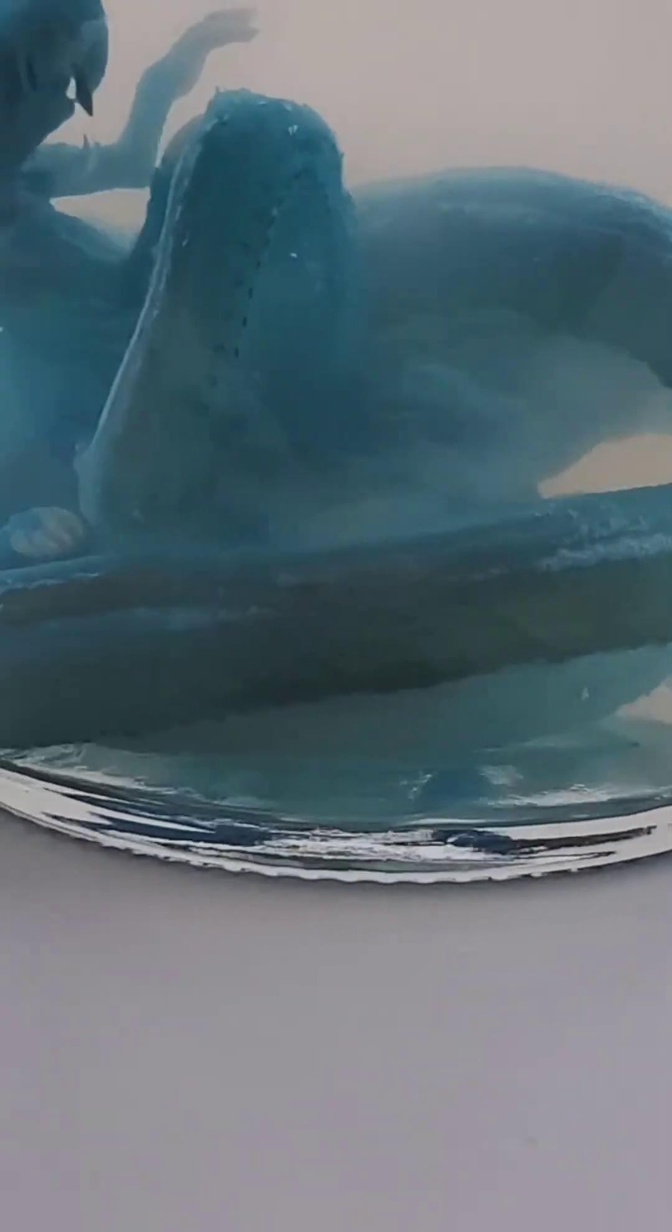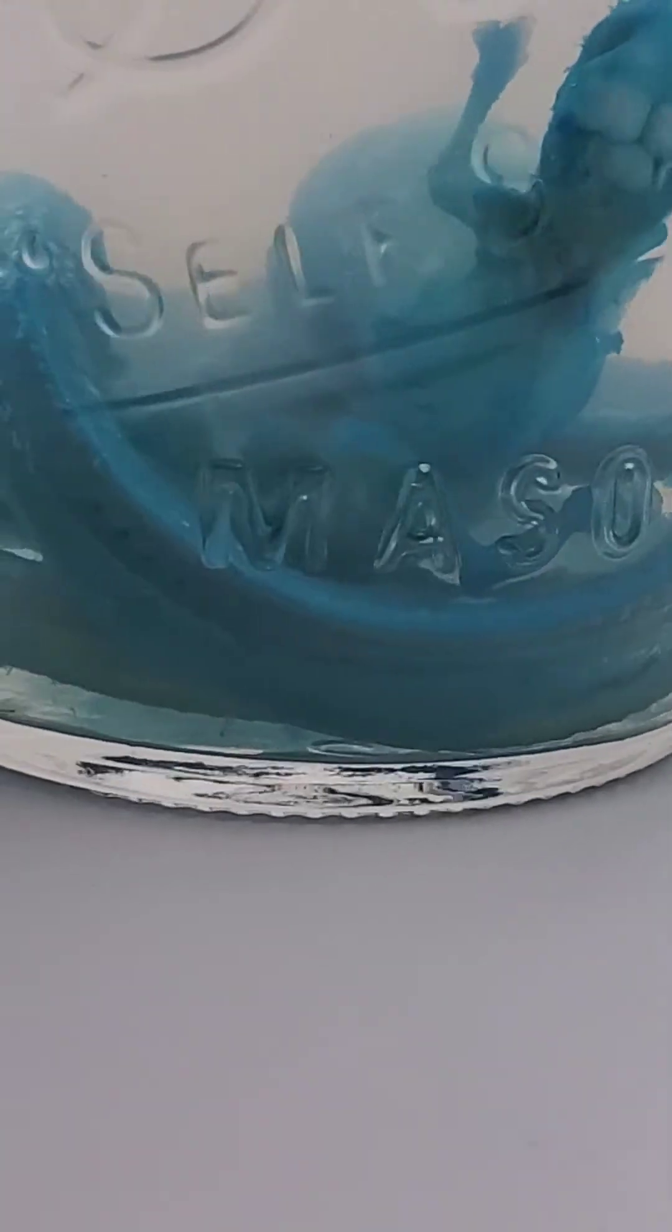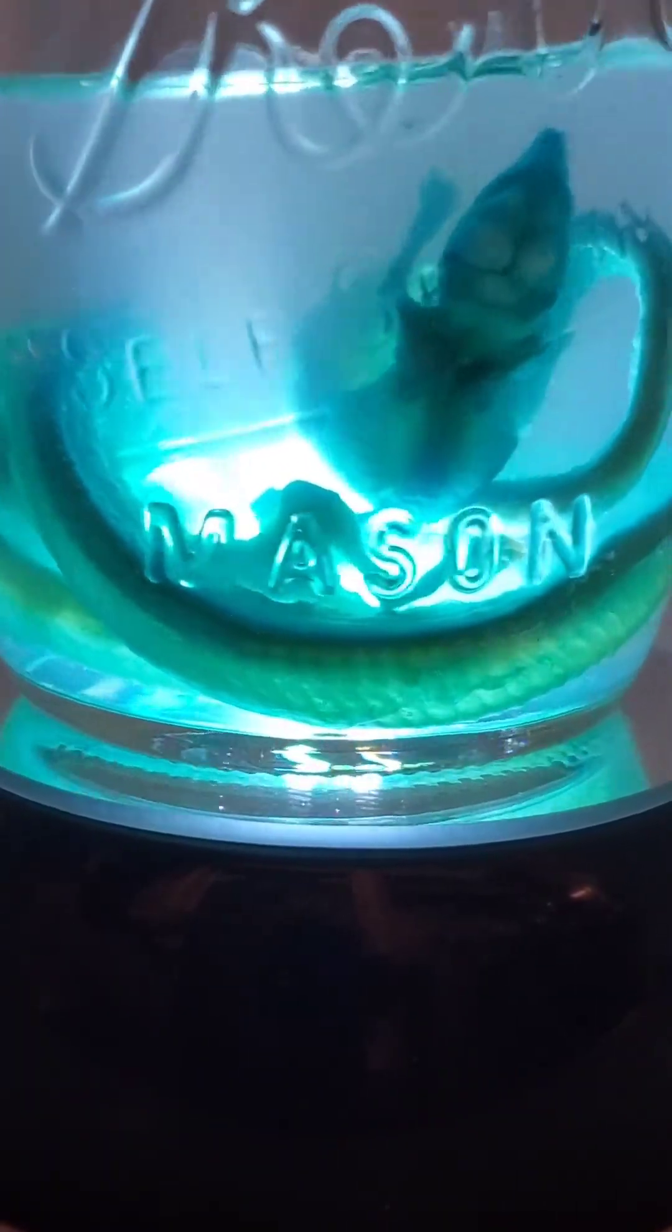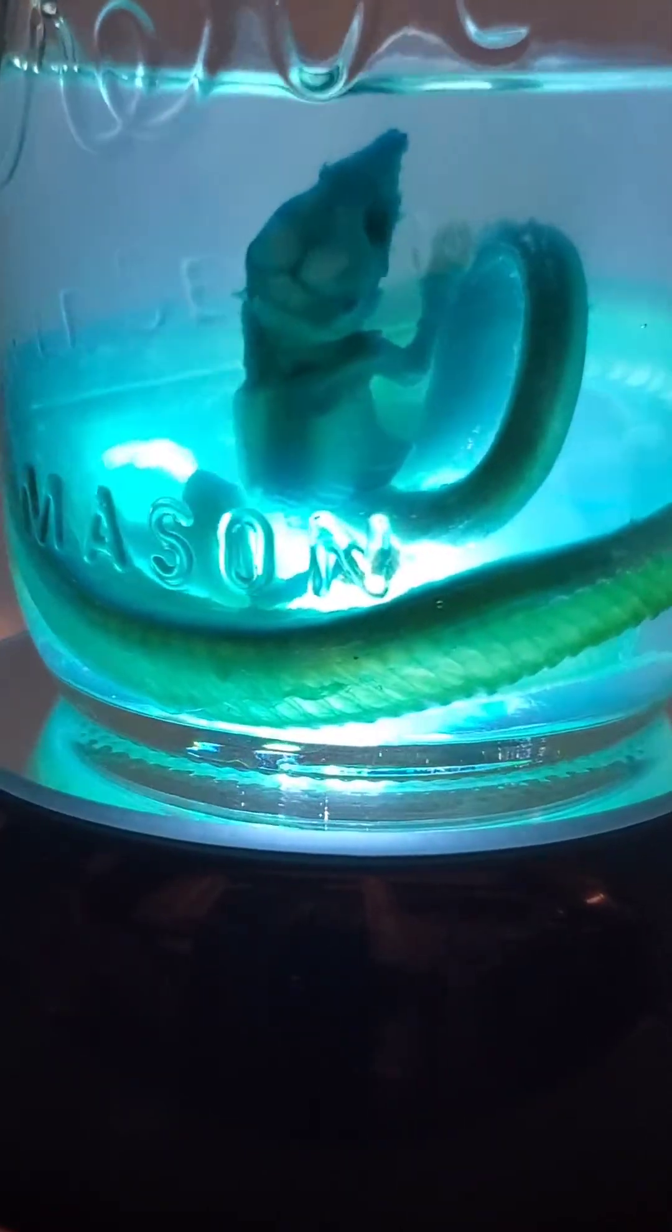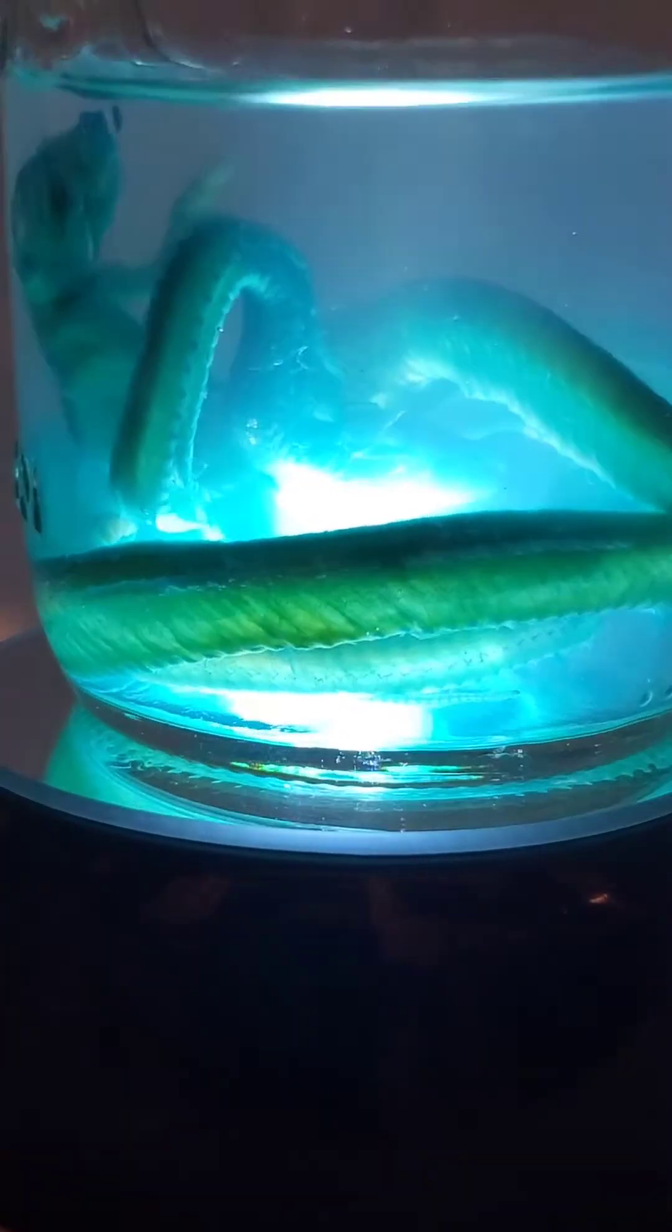Okay, so I just want to take you through how the trypsin bath is going to affect the specimens. Here's what they look like right after we put them in. Here they are after 12 hours. As you can see, they're starting to become a little more transparent.